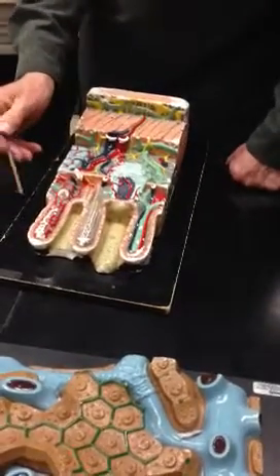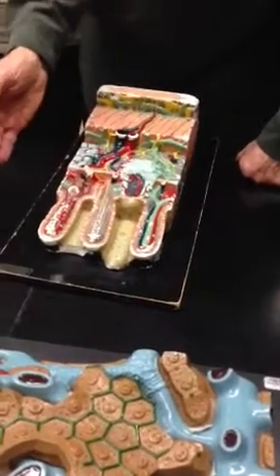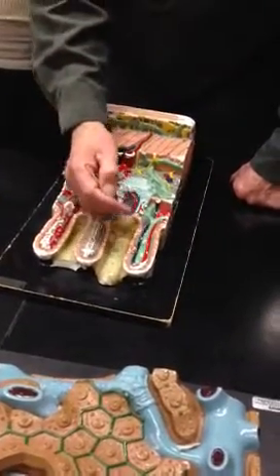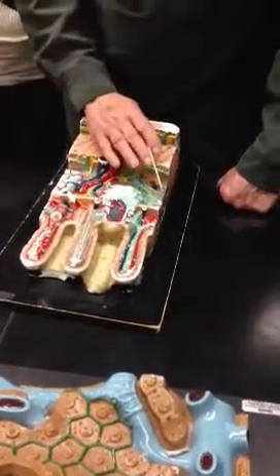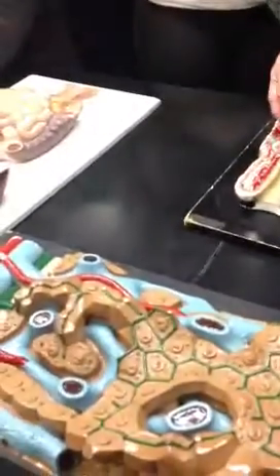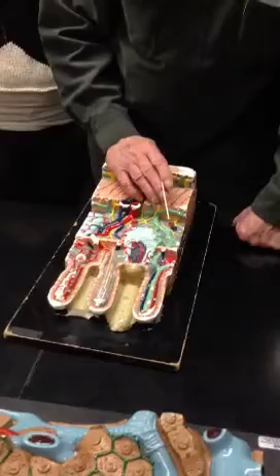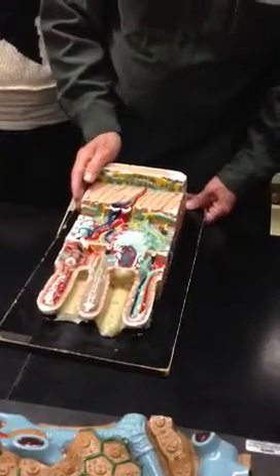All right, so we've got this capillary network, capillary net, let's call it. You don't have to worry about this arteriovenous anastomosis that I show you. I promise not to ask you for it. So you should know capillary net, you should know lacteal, you should know villus, you should know columnar epithelial cell, you should know goblet cell. All right, so far. Next.